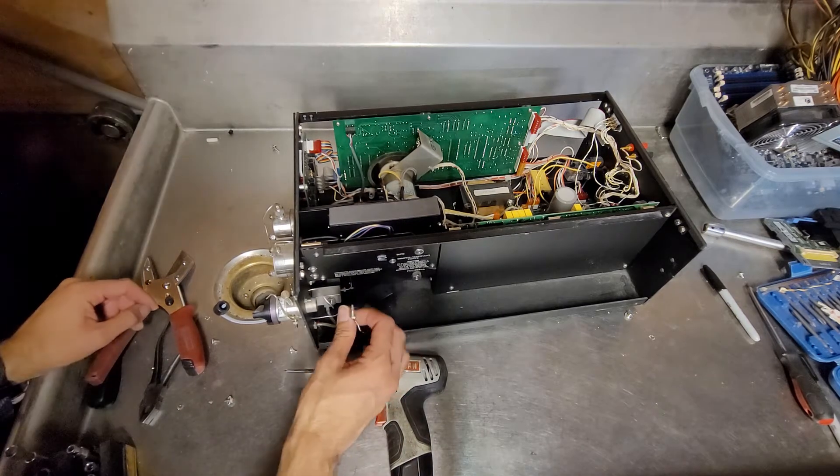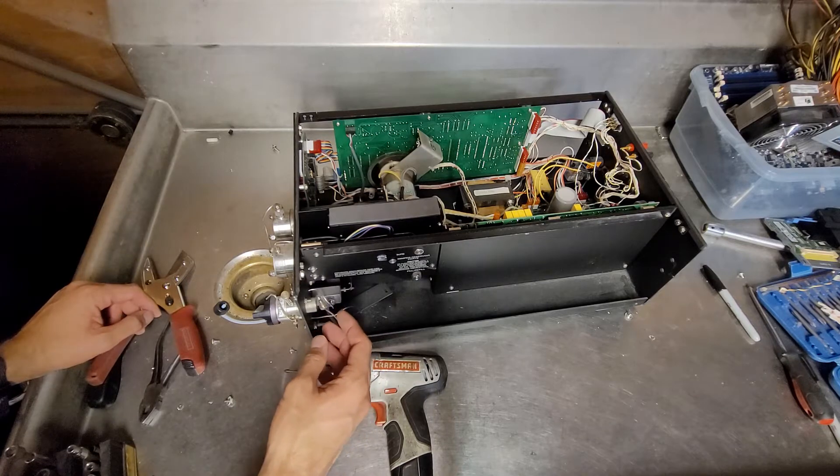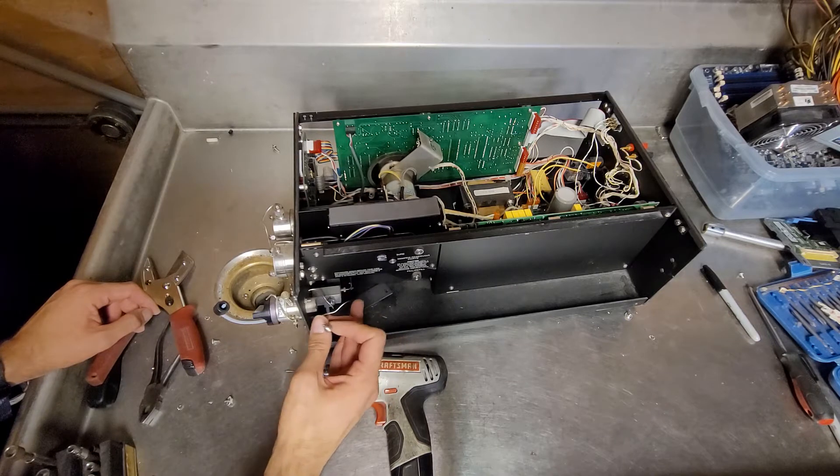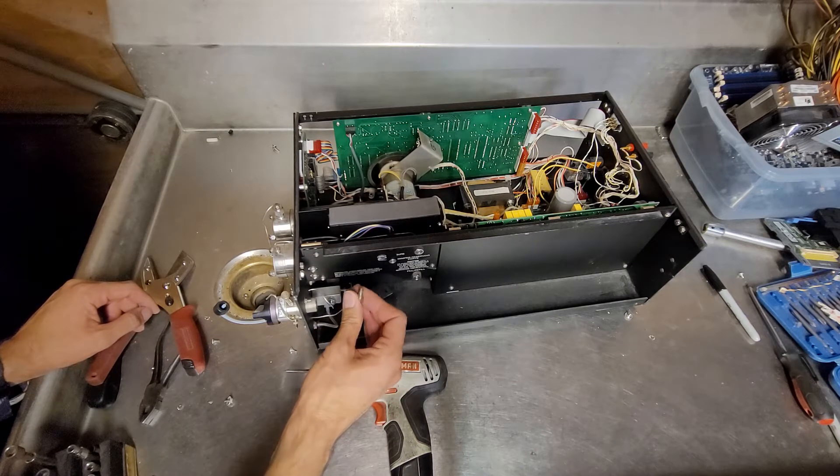It's interesting. So they've been connected to something. Looks like there was a cover that was missing on this side, so there must have been a canister of maybe gas or something that went there.